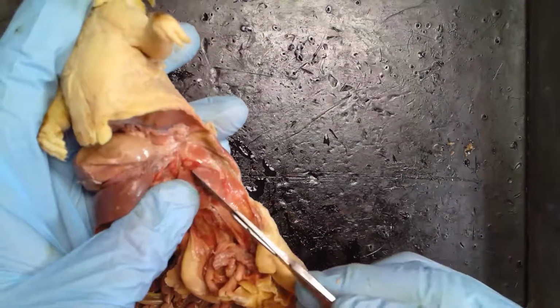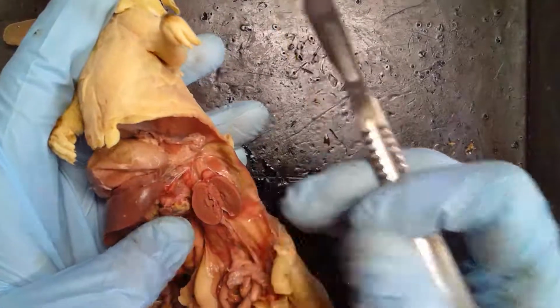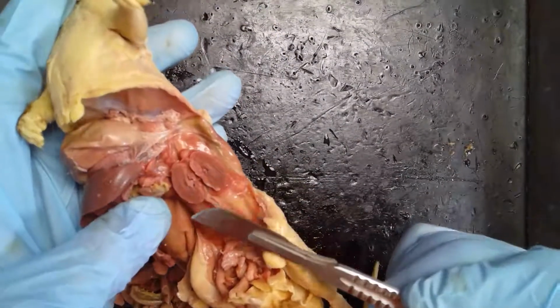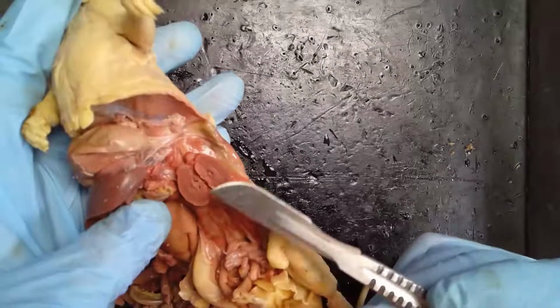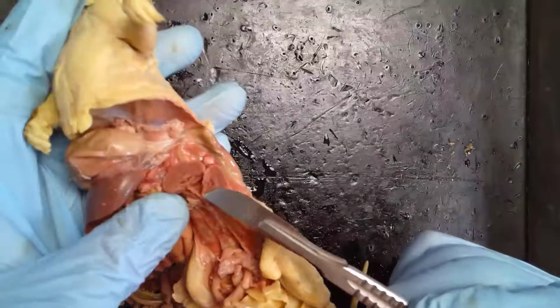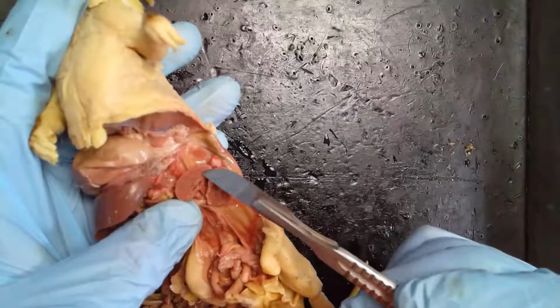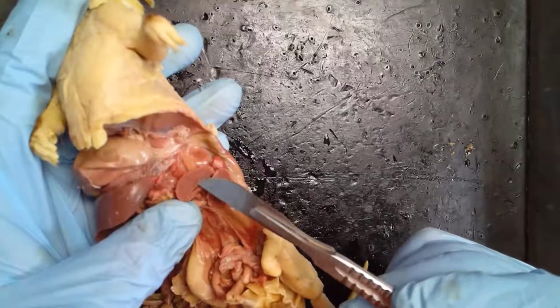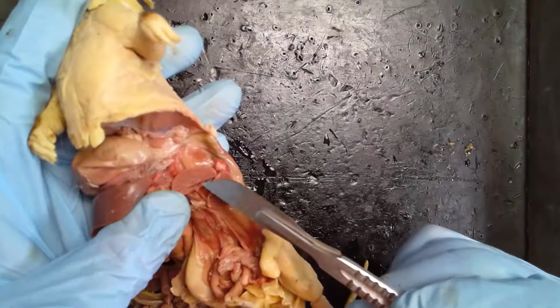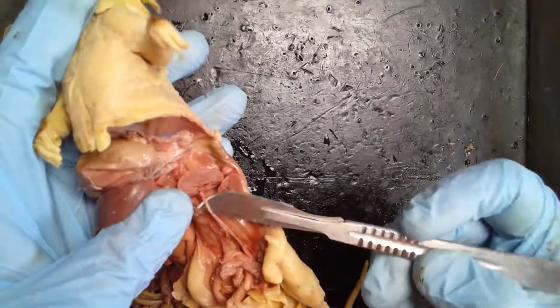Okay, so we can look at what it looks like inside. I see muscle. Okay. So, it's a little hard to see, but you could see the holes? There's some structure here. There's a little bit of cortex, which is the outer bit. There's some medulla. And then you should see the renal pelvis. It's a little hard to see, but it's in there. And so this collects the urine, which then goes into the ureter, which is shown here.